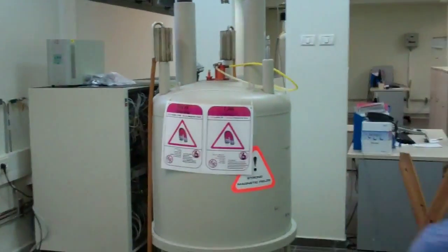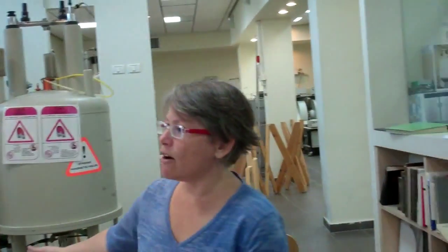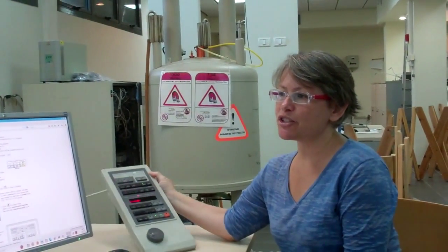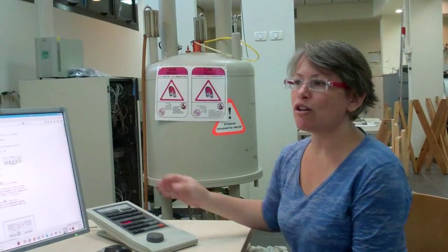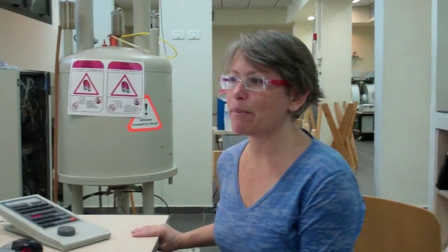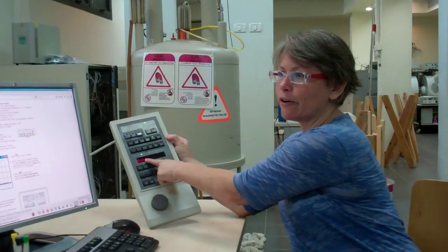The sample is sitting on a cushion of air. The green light is now off after pushing the lift button. As the lift air is turned off, the pressure is slowly lowered and the sample is gently placed into the coil at the center of the magnet. When the spectrometer recognizes that the sample is correctly positioned, the red missing light will change to green down.